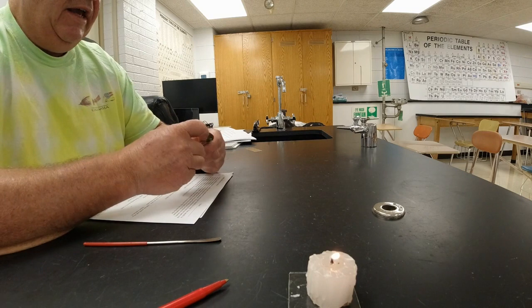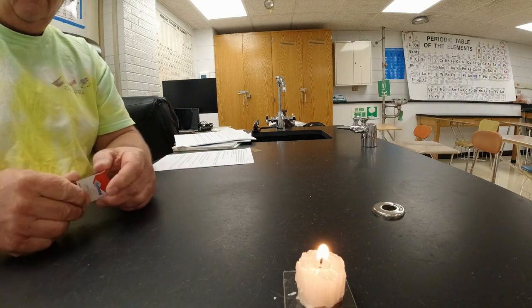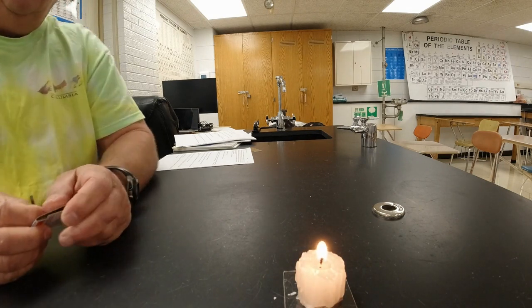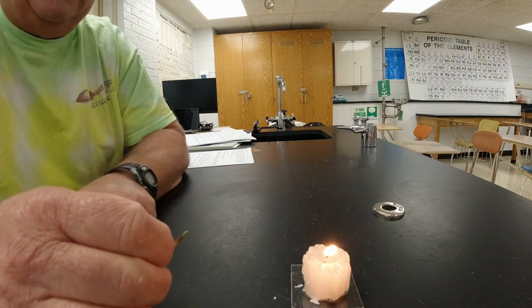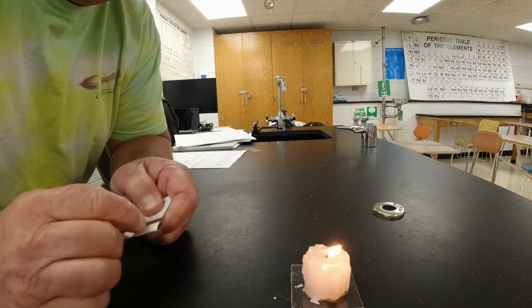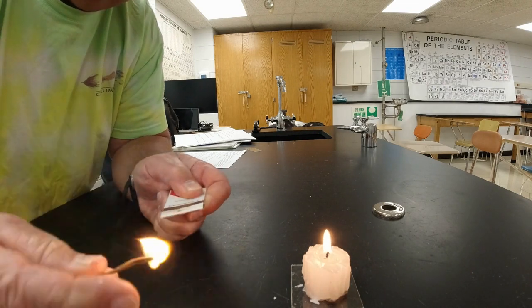All right, we're going to see if this works. If it doesn't, we'll try a different thing. There we go. That's working a little better now. All right, so we're going to try it again here. What I have here, this candle's been burning pretty good for a while. I got a little bit larger flame, and so what I'm going to do is I'm going to light a match. I'm going to gently blow out the candle, and I'm going to try to relight the candle. I'm going to put a burning match in the smoke just above it and see what happens.